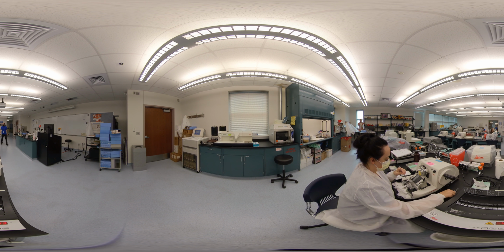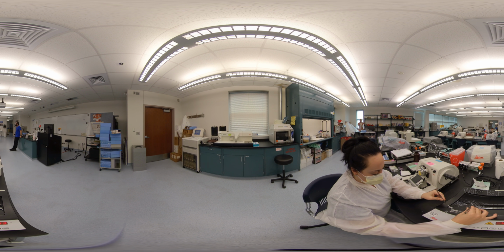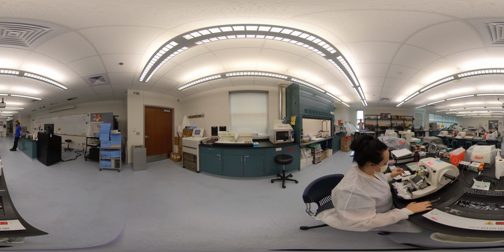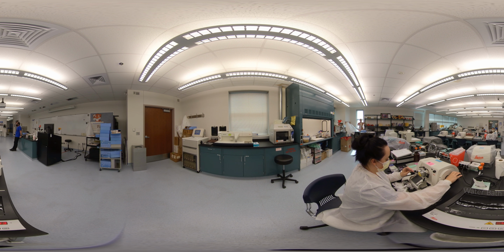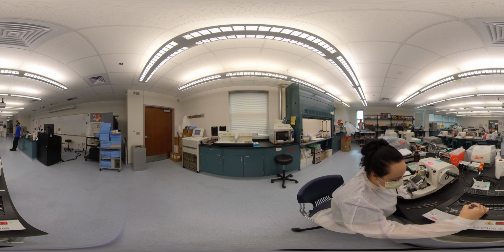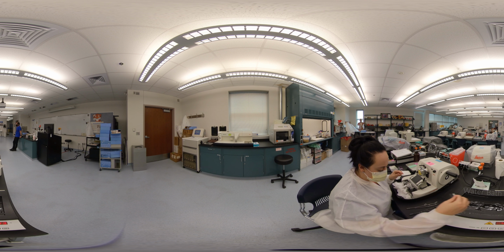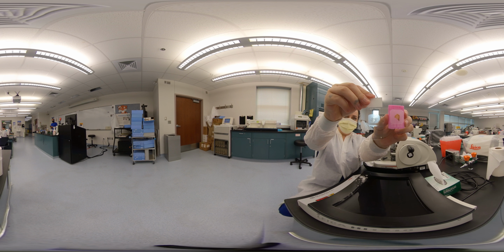What you see here is a block being cut using a microtome. Thin sections are made and floated on a water bath. Each section is about 3 to 5 micrometers thick. When a good section is identified on the water bath, it is picked up by using a glass slide, which is then air dried and ready for the next step, which is staining. This is what it looks like when the slide and corresponding block has been cut. Notice the mirror image on the block and slide.